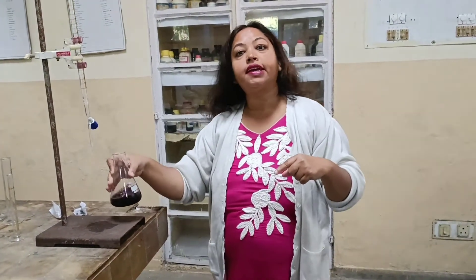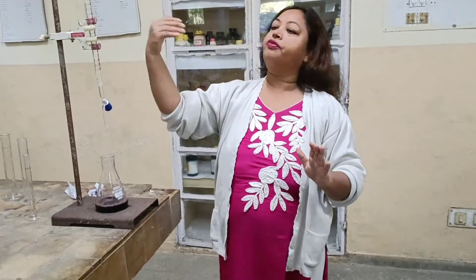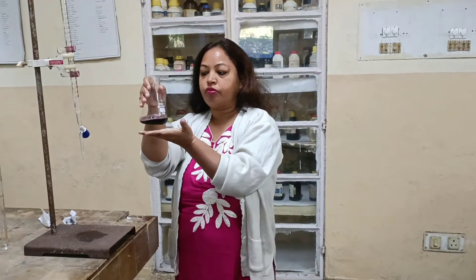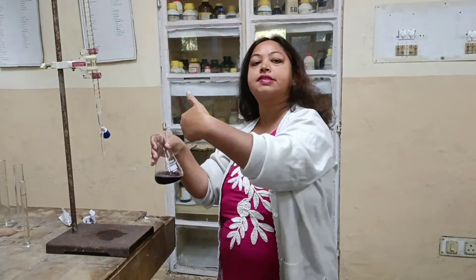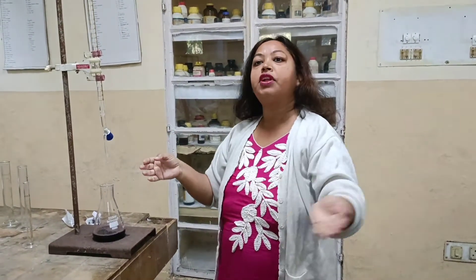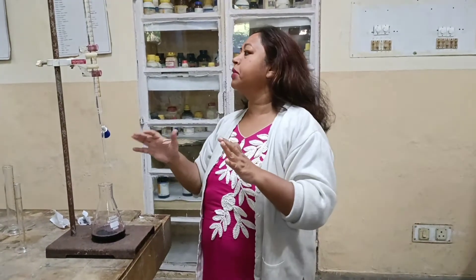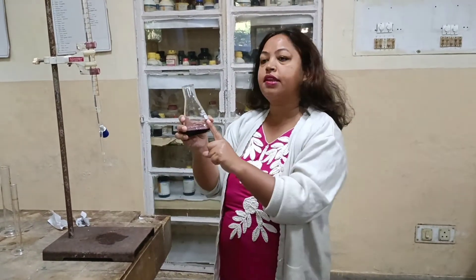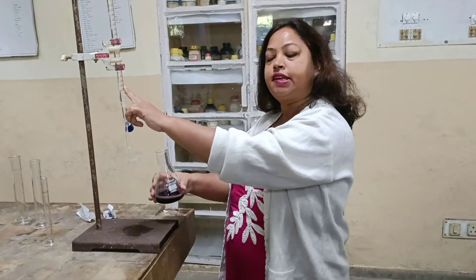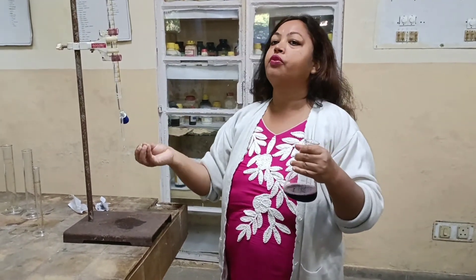The dyes or indicators used in complexometric titration are specific dyes which initially give a different colour because the dye-metal complex is formed. The dye is our calcone and the metal is calcium, and we get this colour. But when we add the complexing agent from the burette, this dye-metal complex will break down. The dye will be separate and the metal will be separate, and we will get a different colour — that is blue colour.